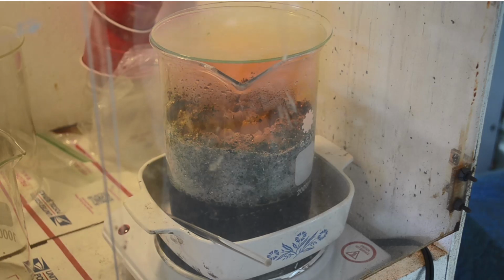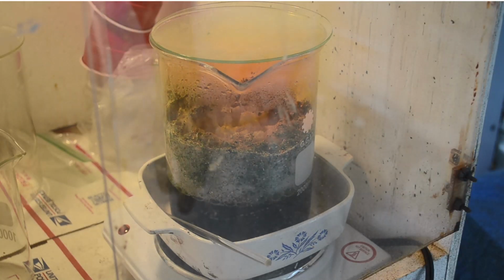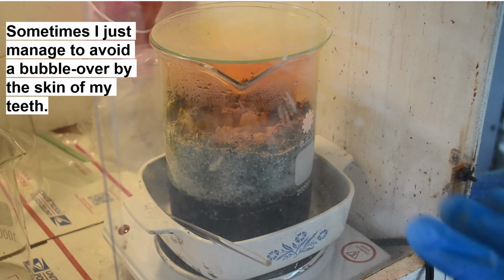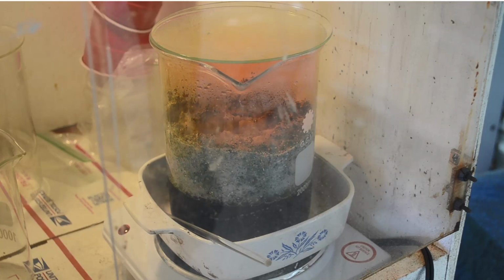Okay, it's not going well, but it seems to have stabilized. The foam doesn't seem to be getting any worse. We're producing orange fumes, so the reaction is going on. I think I have enough liquid in there now between the extra hydrochloric acid I added and the water I've been spraying on to knock down the foam, that the foam is a little less stiff, I guess. And what I'm seeing is the bubbles of nitrogen dioxide are coming out. The foam kind of relaxes down. It sort of puffs up and relaxes down. So things aren't getting any worse. Not getting any better, but they're not getting any worse. So I'm just going to let this go and see what happens. See if we can run this to completion.